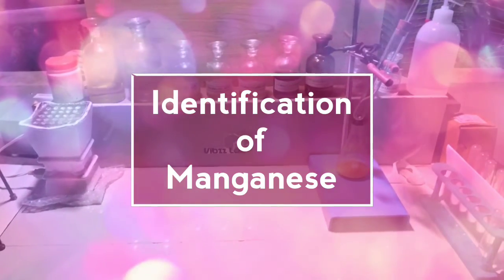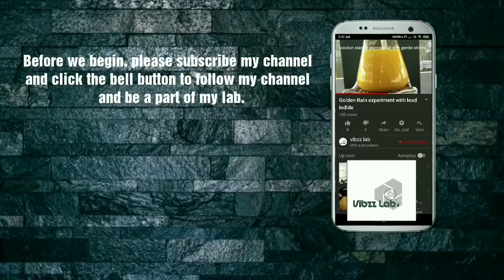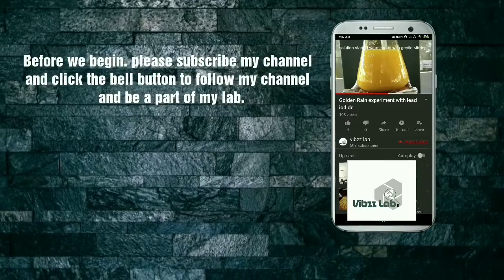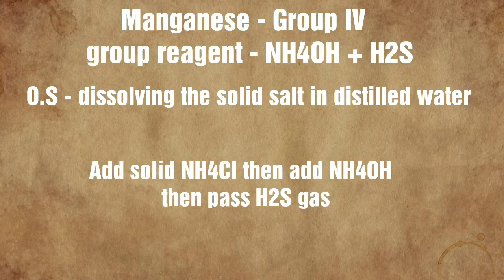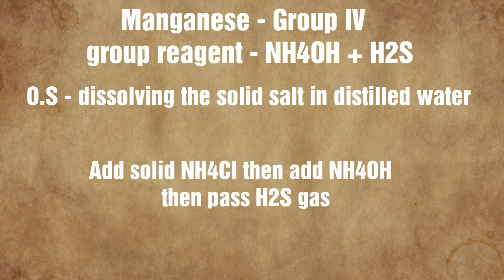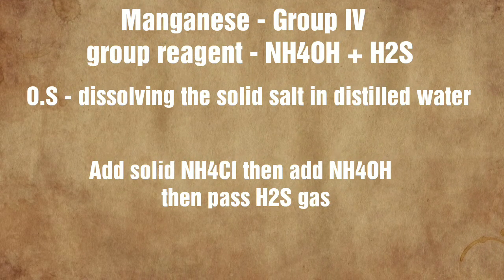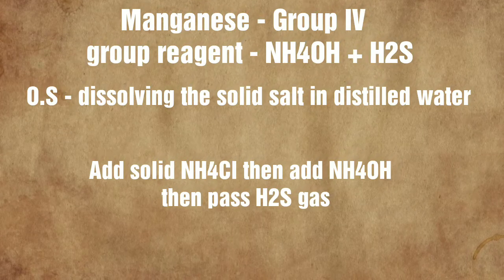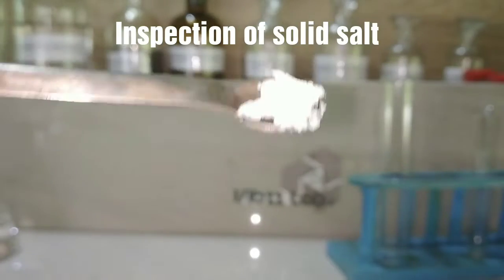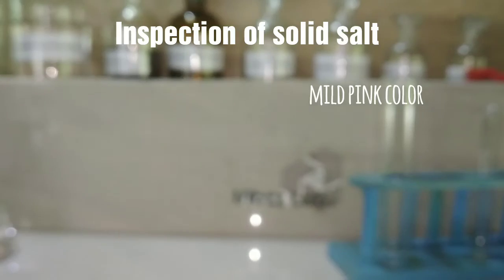Today we will be doing the identification of manganese ions. Manganese belongs to group 4 and the group reagent is ammonium hydroxide with hydrogen sulfide. First we prepare the original solution and then we add the group reagent. Let us inspect the solid salt first — it appears a mild pink color.